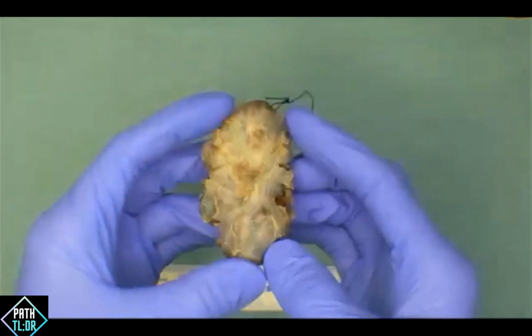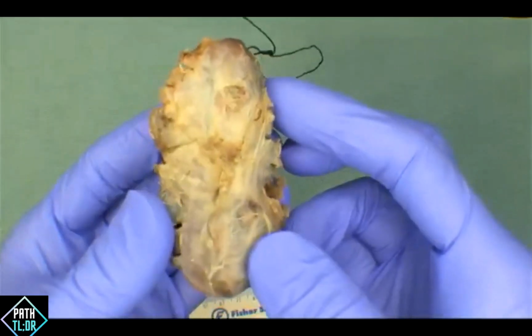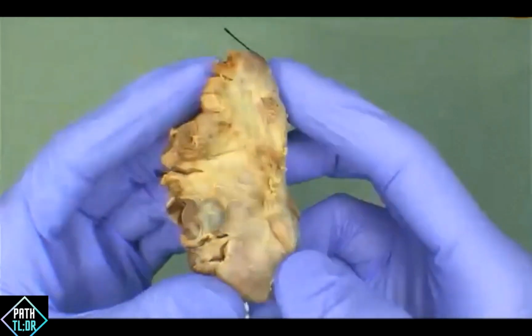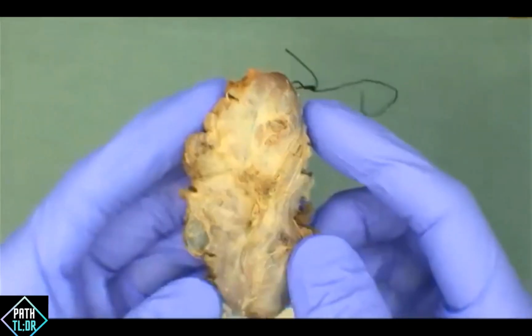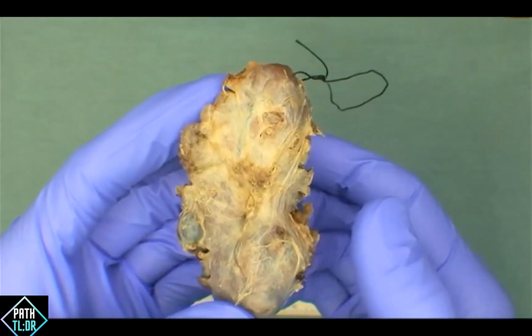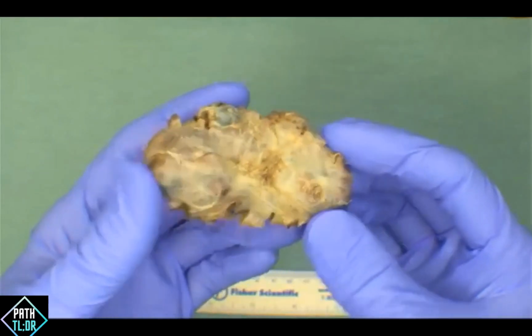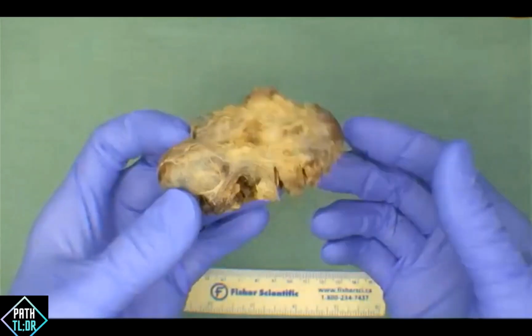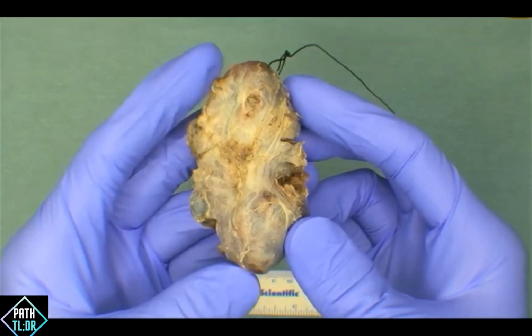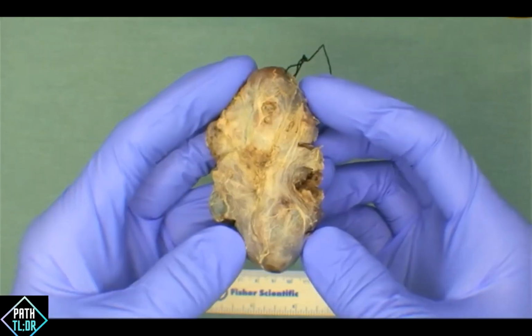One of the more important features is that you would typically expect to see some mucosa on the surface of the tongue, whether it be on the side or on the dorsal-ventral aspects of the tongue, depending on the type of resection that's been excised. So I'm glad nobody selected uterus. This would be an unusual configuration for uterus. We're missing a lot of the different landmarks that we would typically expect. We're missing the body of the uterus, the uterine cervix, the fallopian tubes and ovaries.